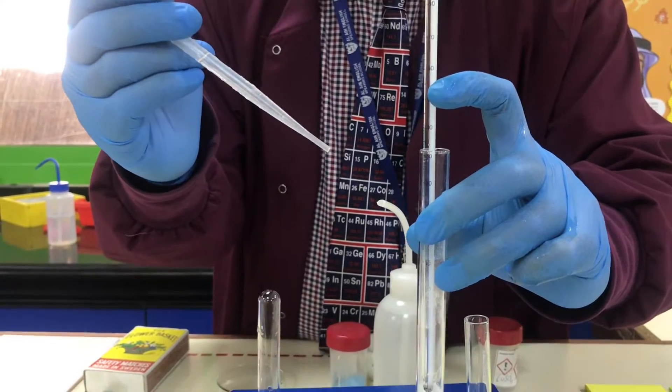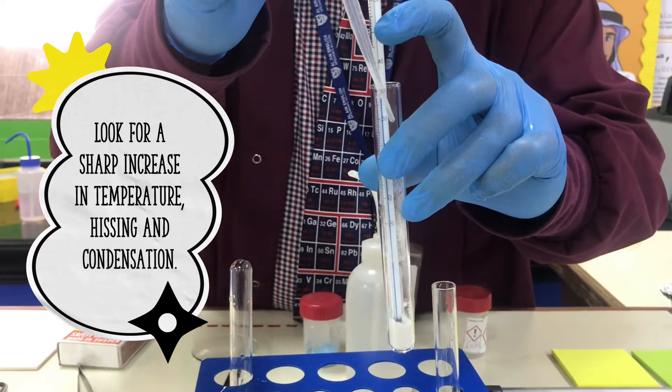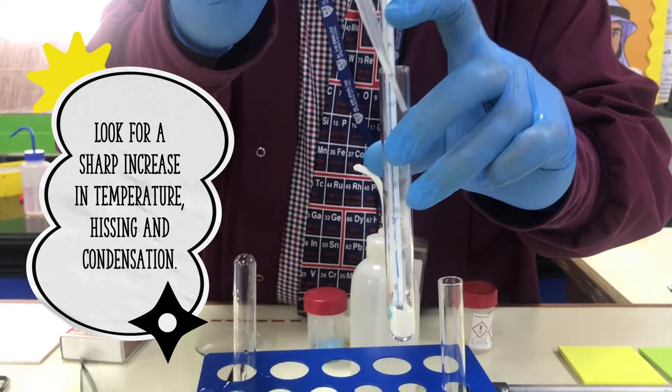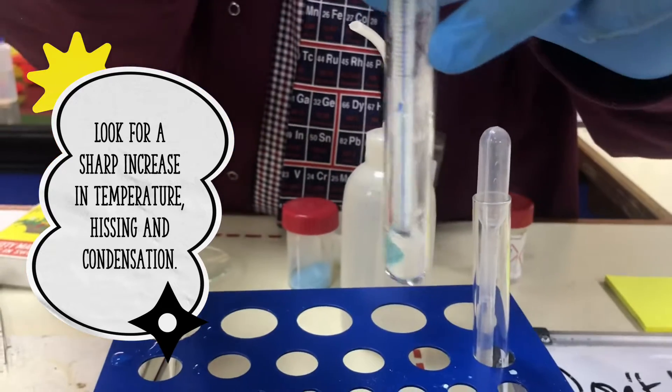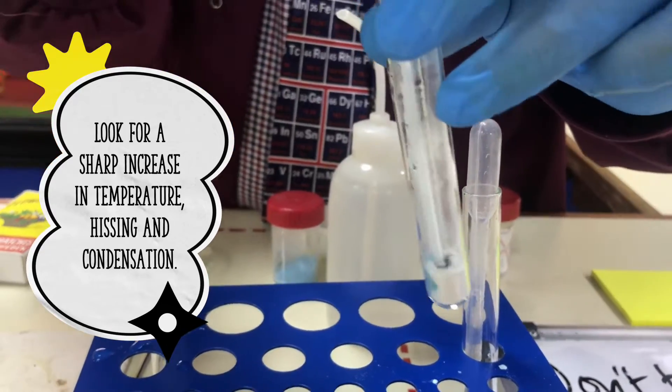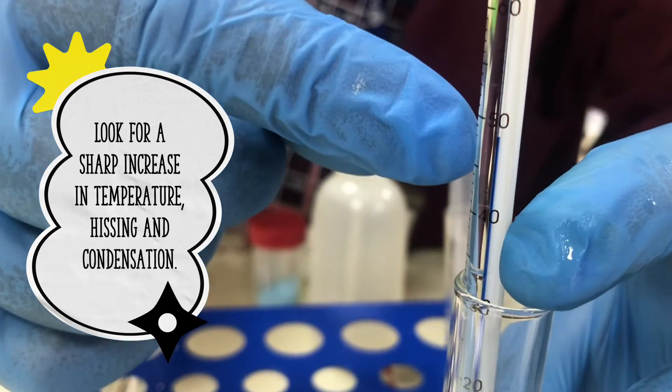So should get a reaction. Okay, so in goes the water again and immediately fizzes. I just need four drops maximum I reckon.